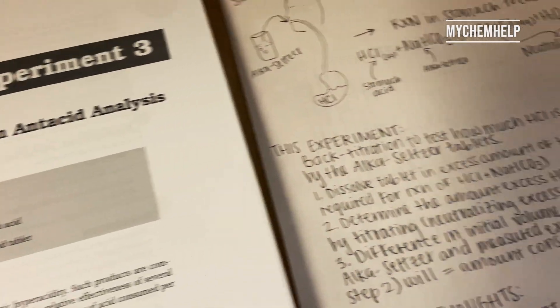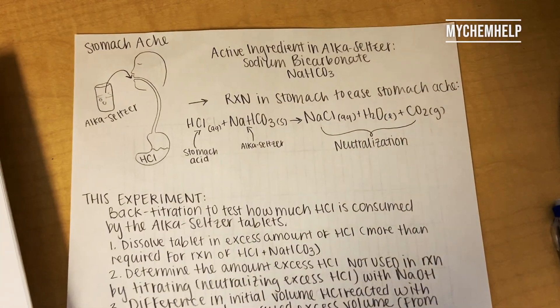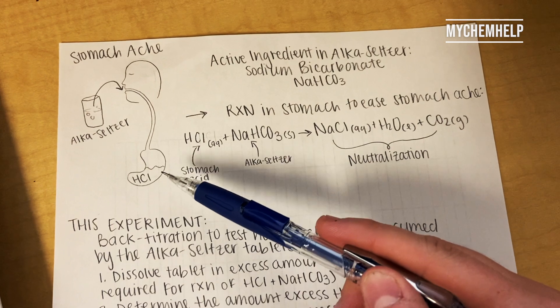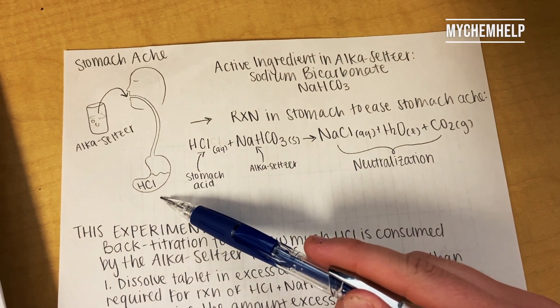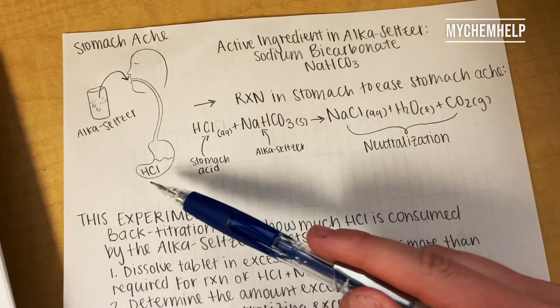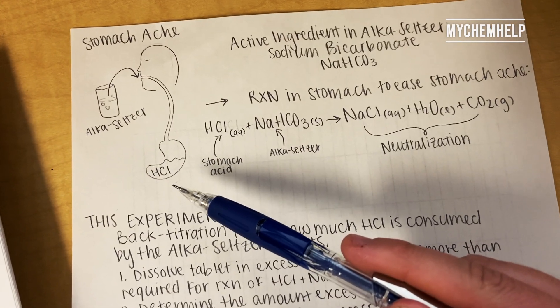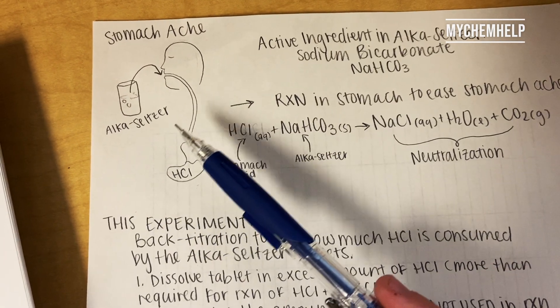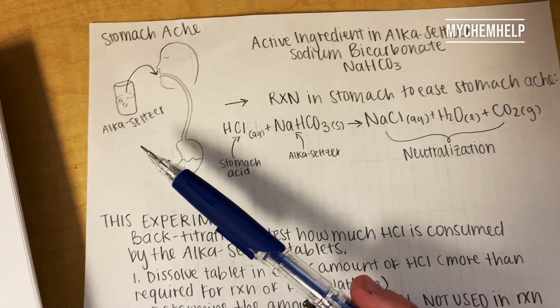I have illustrated a little bit about what we're doing here. This illustrates when you have a stomach ache — your stomach generates hydrochloric acid normally, but sometimes when you overeat or something, your stomach will generate more hydrochloric acid. To neutralize this excess amount, you usually take something like Alka-Seltzer or Tums, and today we're going to look at Alka-Seltzer.